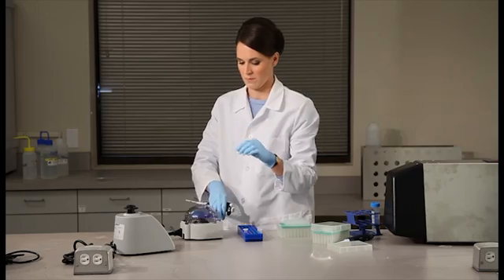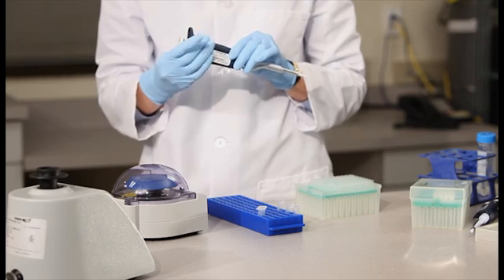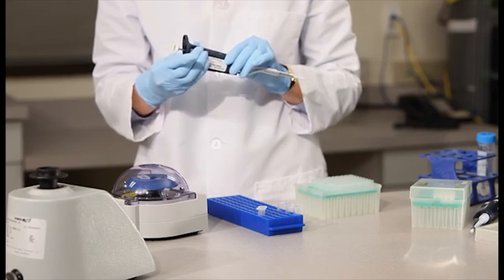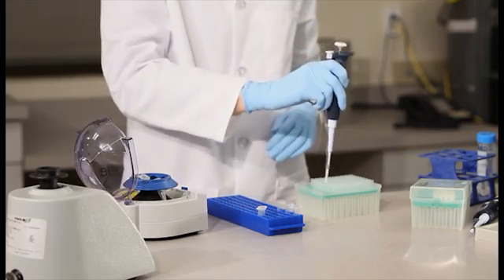Make sure to vortex and spin each tube in turn. Then, add 20 microliters of DNA extract from the corresponding tube.